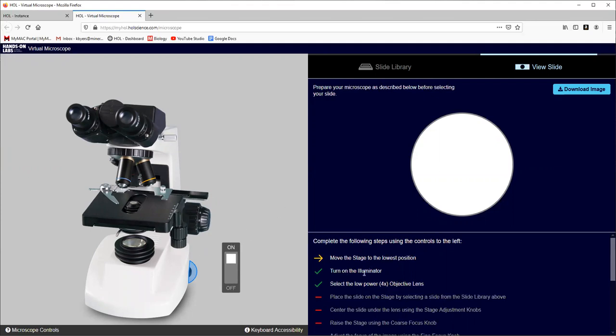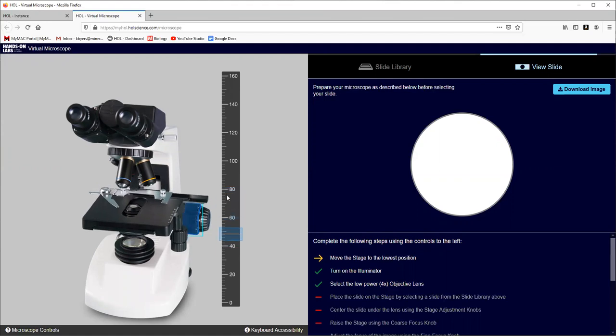So now that the microscope is on, it says turn on the illuminator. We did that and move the stage to the lowest position. So the adjustment knobs, that's what's going to move your stage up and down, closer or further away from those slides. So we'll either have the coarse adjustment, which is the large knob that really moves the slide, or the fine adjustment, which barely moves that slide at all. If we were in the classroom, I would tell you that you only use this fine adjustment when you're on the longest lenses, the high power and low power. When we are using this large coarse adjustment, it's okay to use when we're on the scanning, the smallest lens, but these other lenses are too long and we could actually crack the slide.